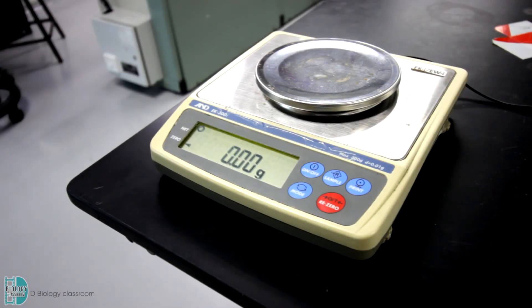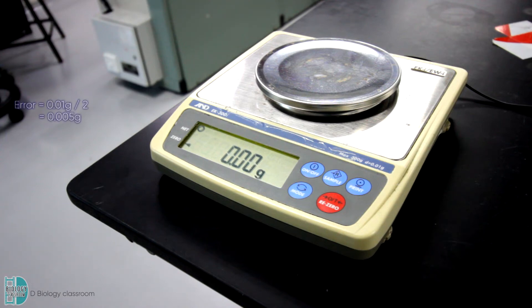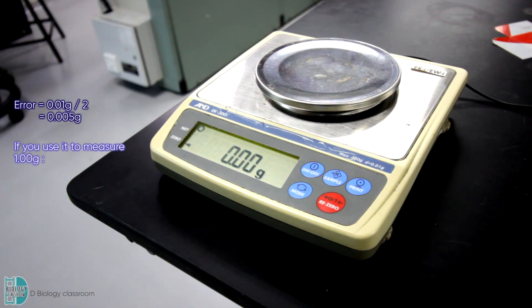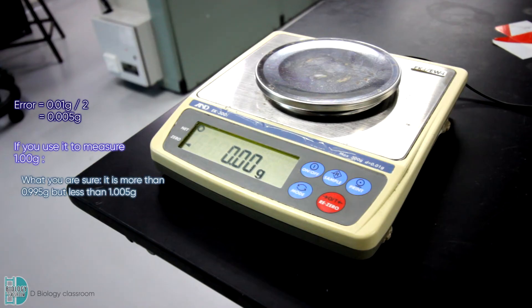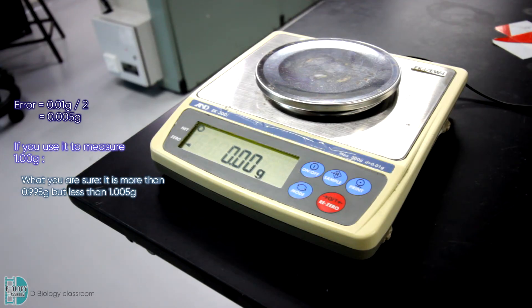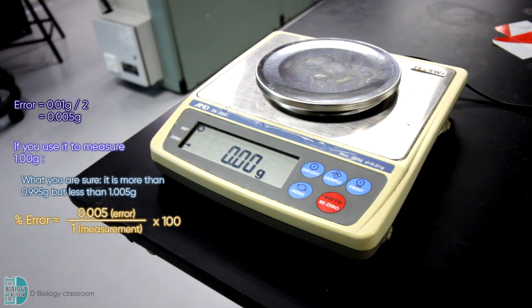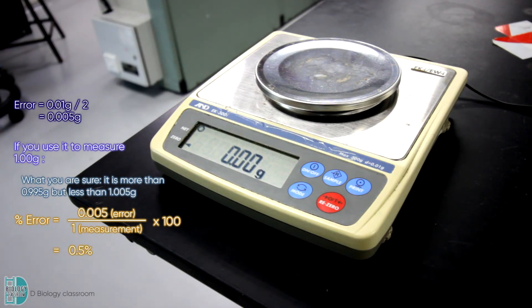This weighing balance reads 0.01 g. The error is half of 0.01 g, which is 0.005 g. This means if you use it to measure 1 g, you know that it is more than 0.995 but less than 1.005 g. The percentage error in a reading of 1 g is 0.005 divided by 1 times 100, which is 0.5%.